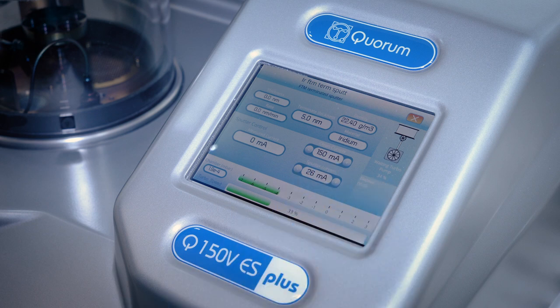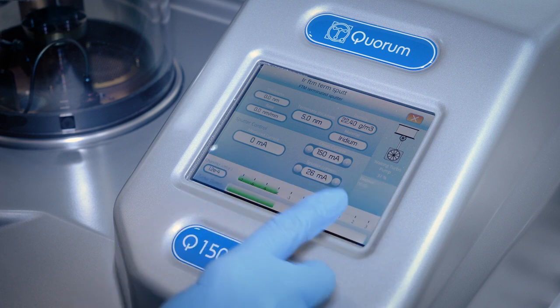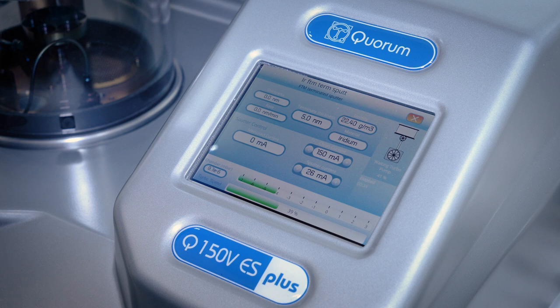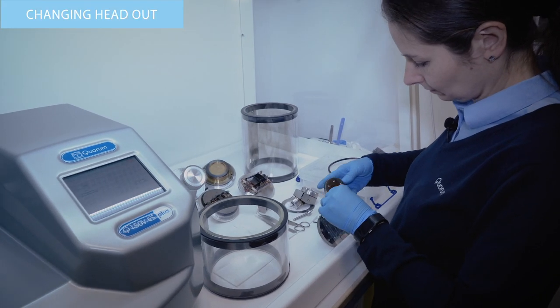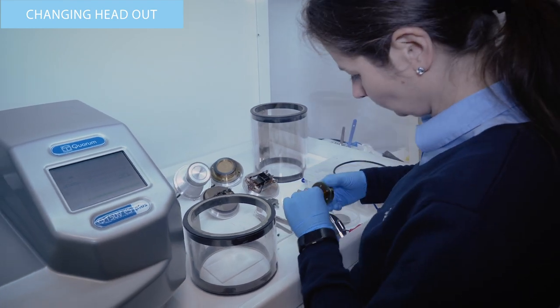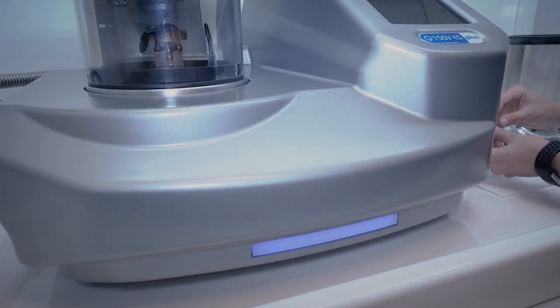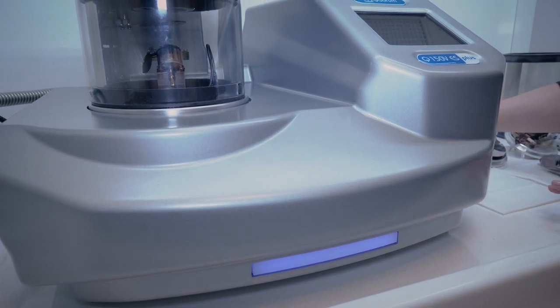While it is running, the user can still edit a few parameters like the cleaning and sputtering current. When there is a need to coat with a different metal than the one which is mounted in the head, it is easy to change the target disk for the one that we want to use.